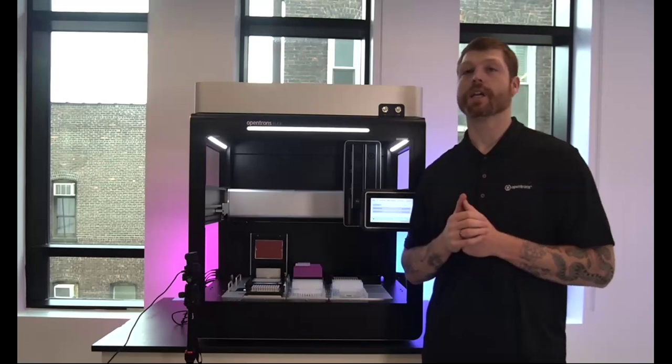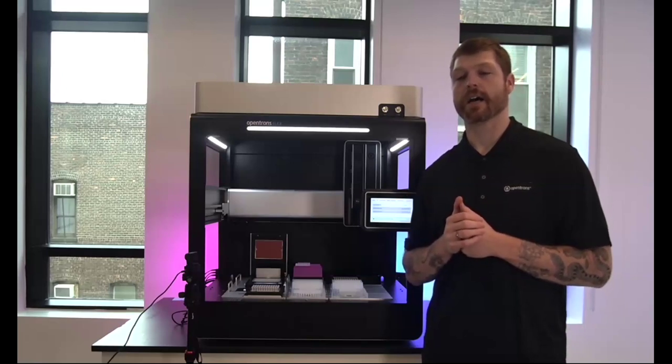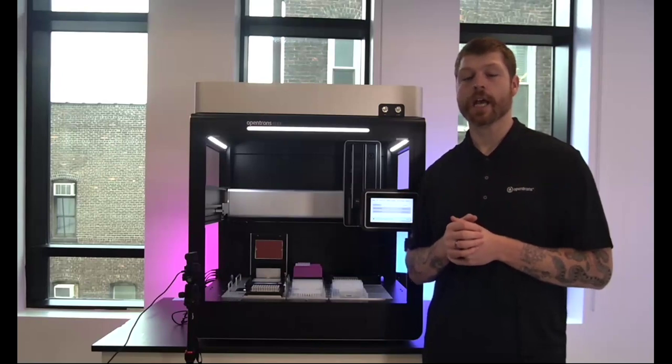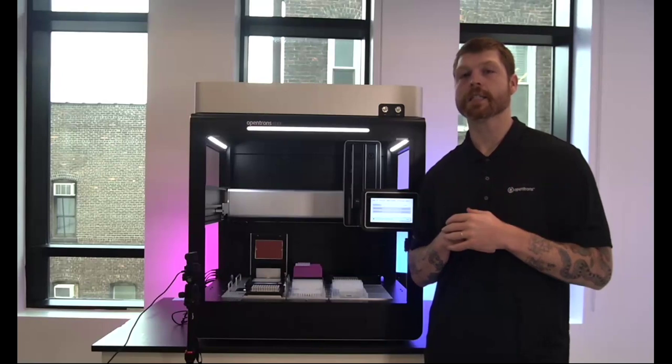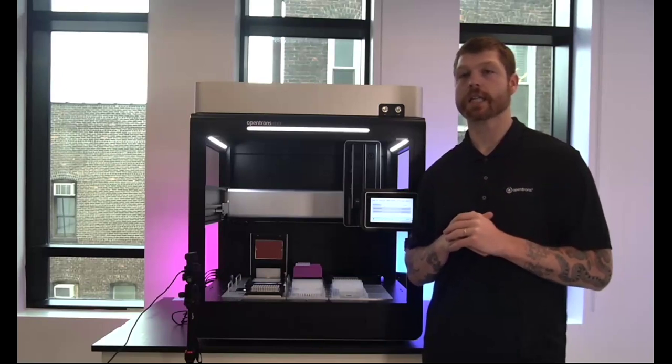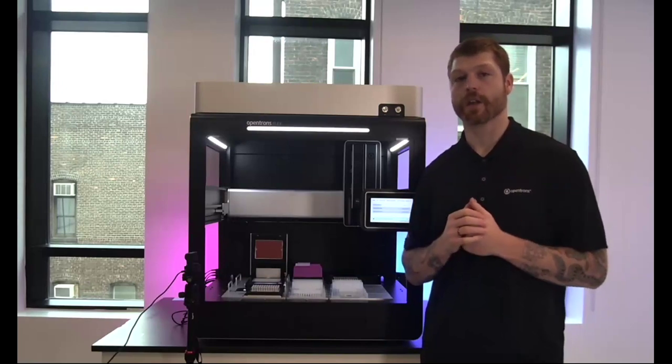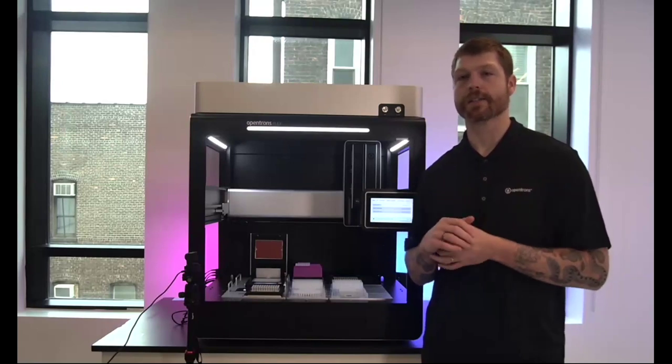Okay, and a couple of questions on liquid detection here. First of all, can the Flex detect pipetting a liquid? And if so, what sort of error message do you get if there is a liquid that isn't present? Yeah, absolutely. So we do have a new feature that is being released with this as well, which is the first phase of our liquid level detection. So the Flex, all pipettes have a pressure sensor within them. So they do have the ability to detect all kinds of liquid, a wider range than capacitive sensors typically yield to.